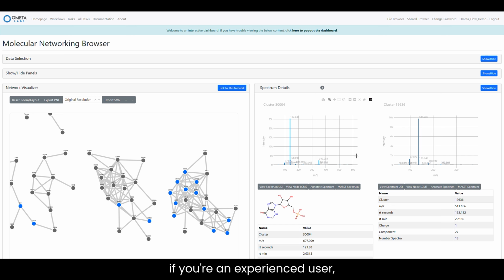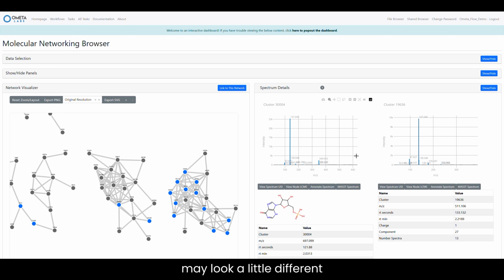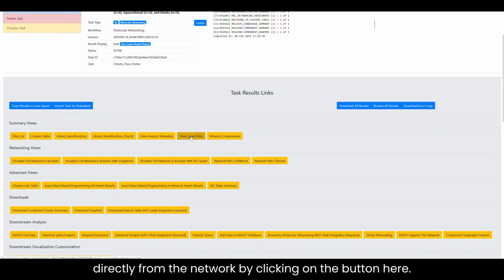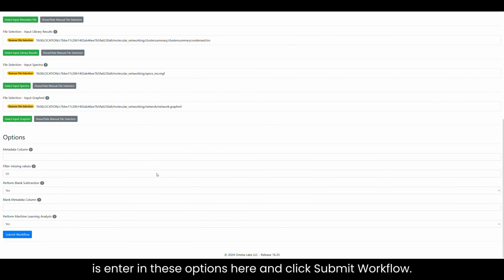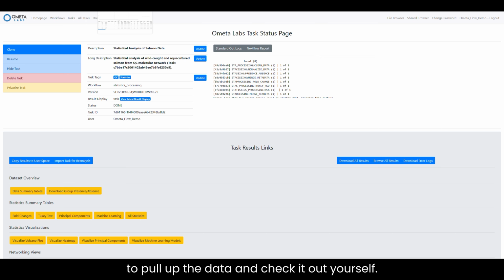One thing to note here, if you're an experienced user, is that we use the MS2Deep score algorithm to make this network, so spectral similarity may look a little different than the same network using our standard cosine scoring. While networking can identify both your target compound and any novel contaminants, statistical analysis can provide information on how the relative abundance of those compounds changes over time. You can run statistical analysis directly from the network by clicking on the button here. This will auto-populate all the correct files, and all you have to do is enter in these options here and click Submit Workflow. You can always use the links below to pull up the data and check it out yourself, but for now, let's look at the volcano plot.